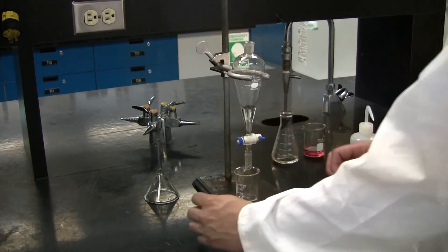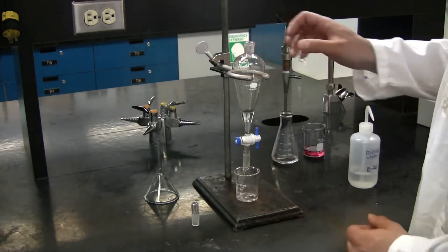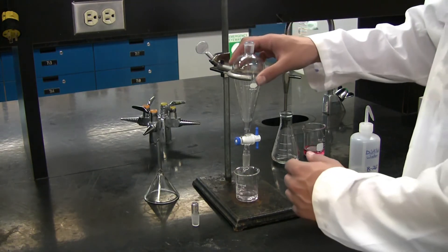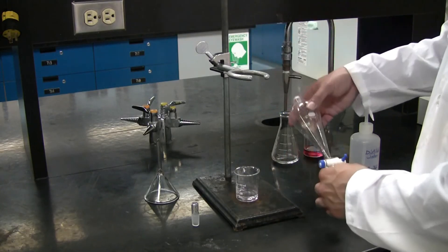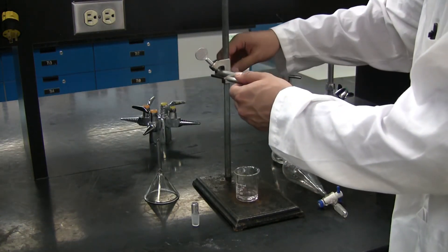Now, drain the waste out of the bottom of the separatory funnel and discard this into a waste bin. All you need to do is remove the separatory funnel from the ring clamp and then the ring clamp itself from the retort stand.